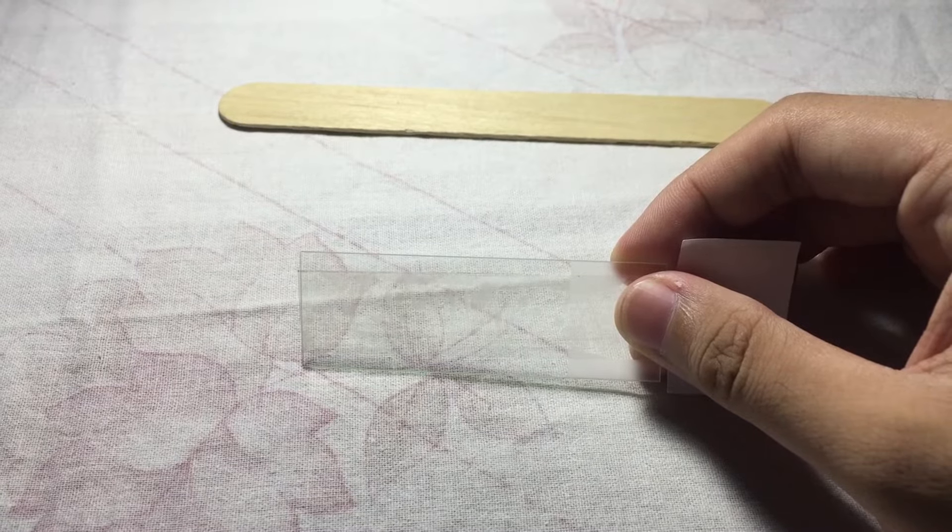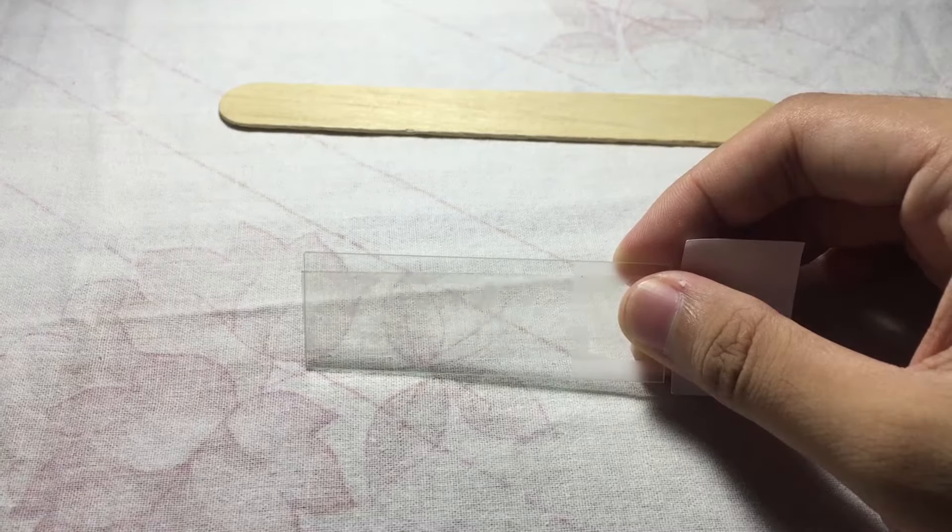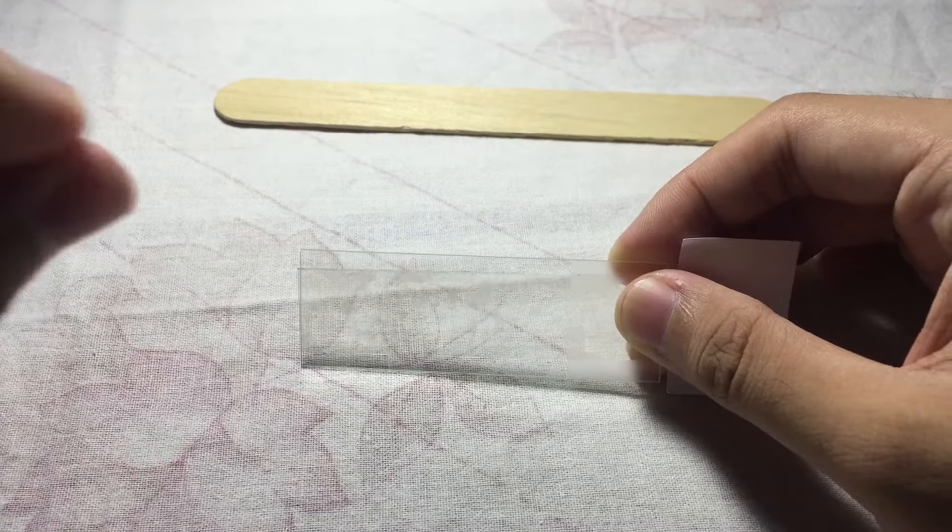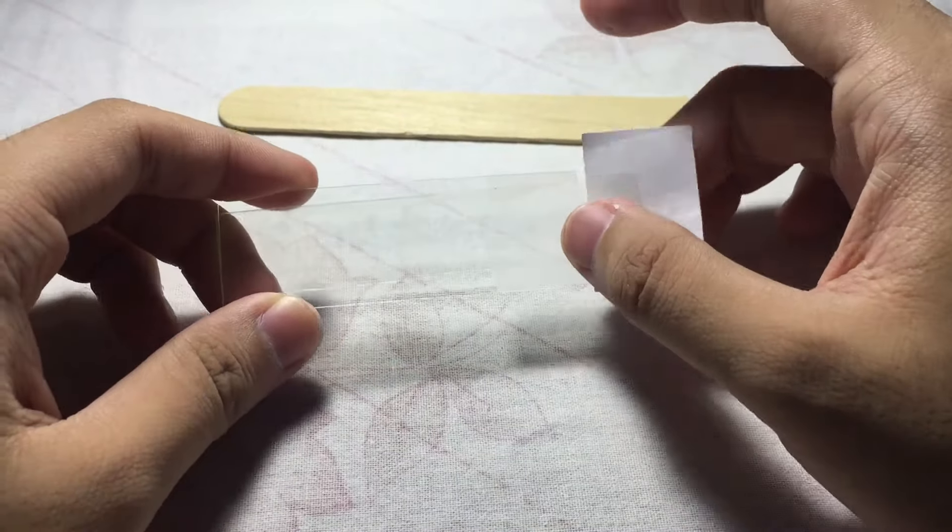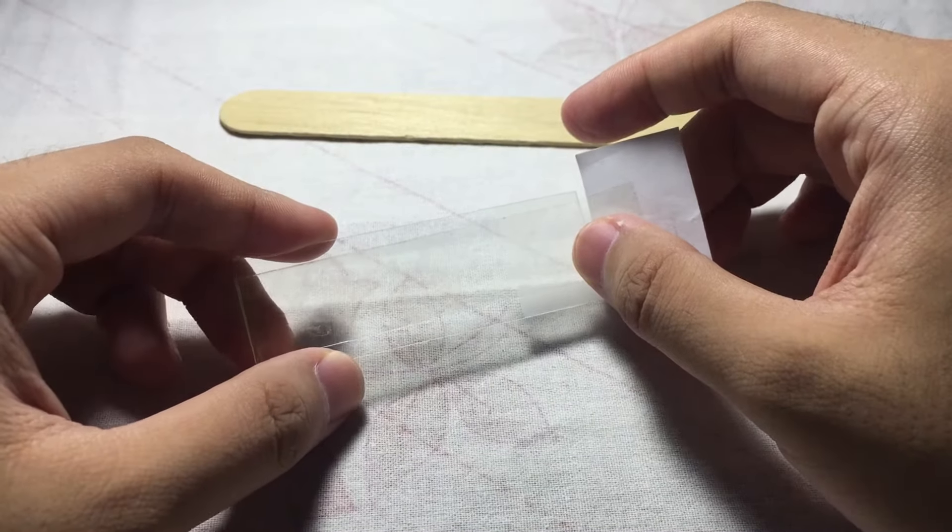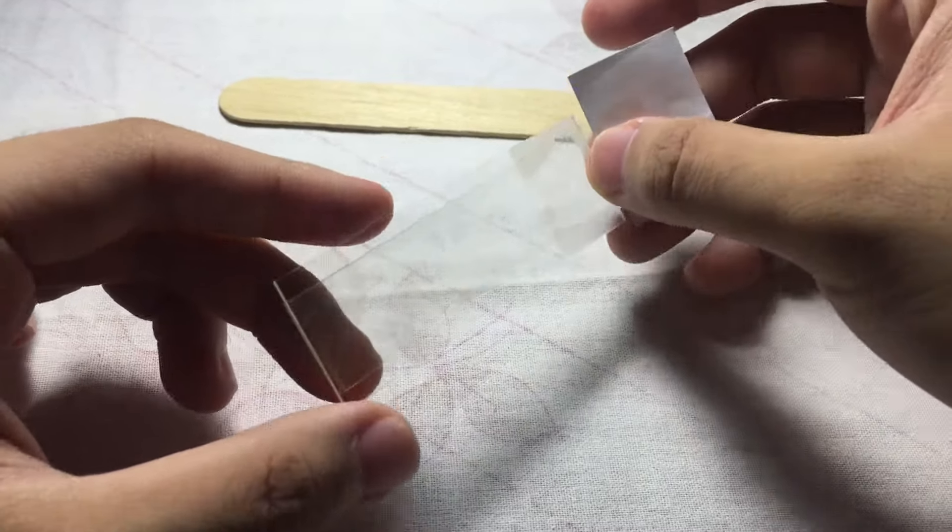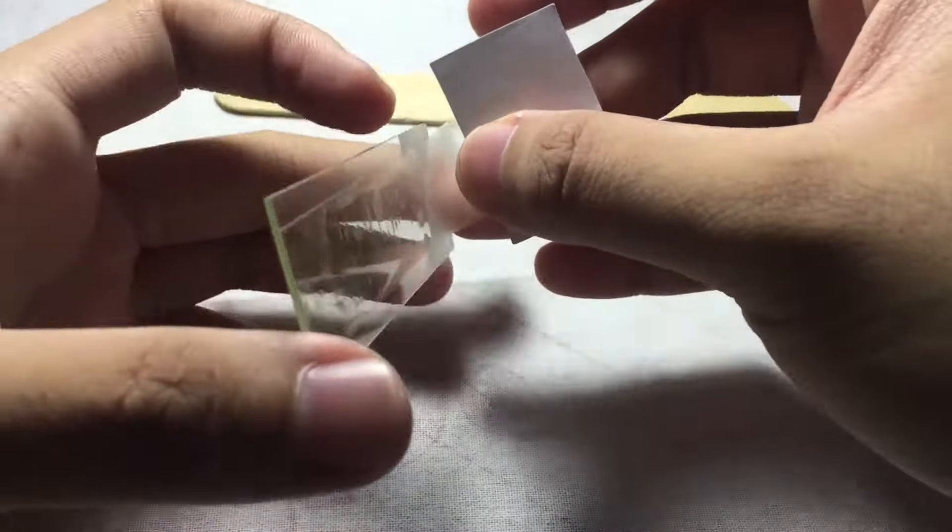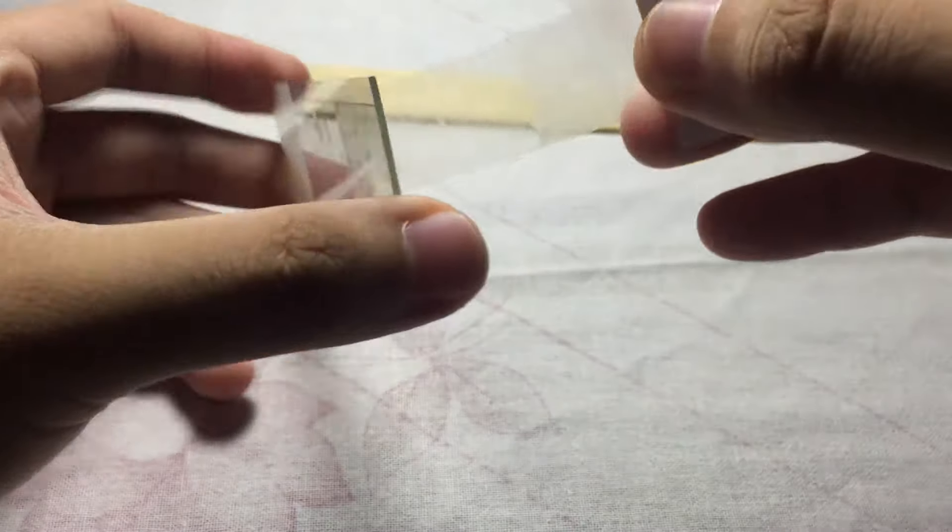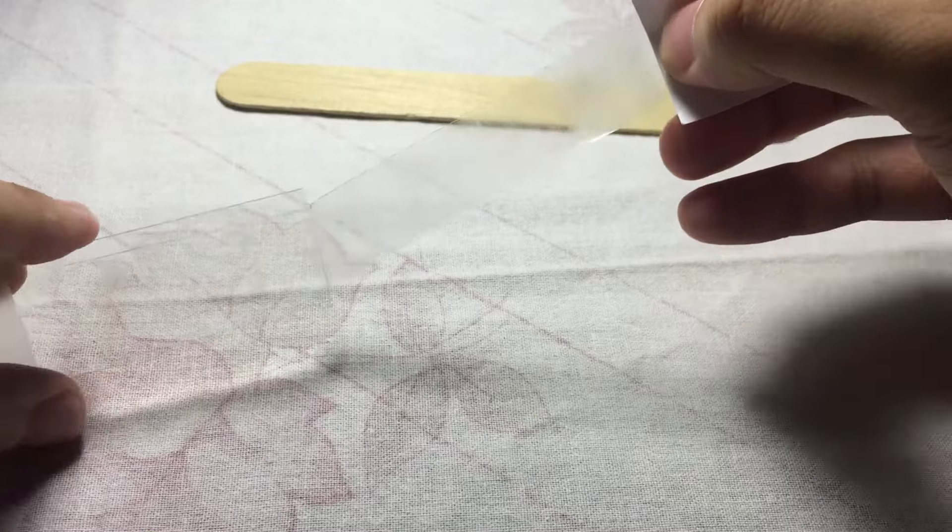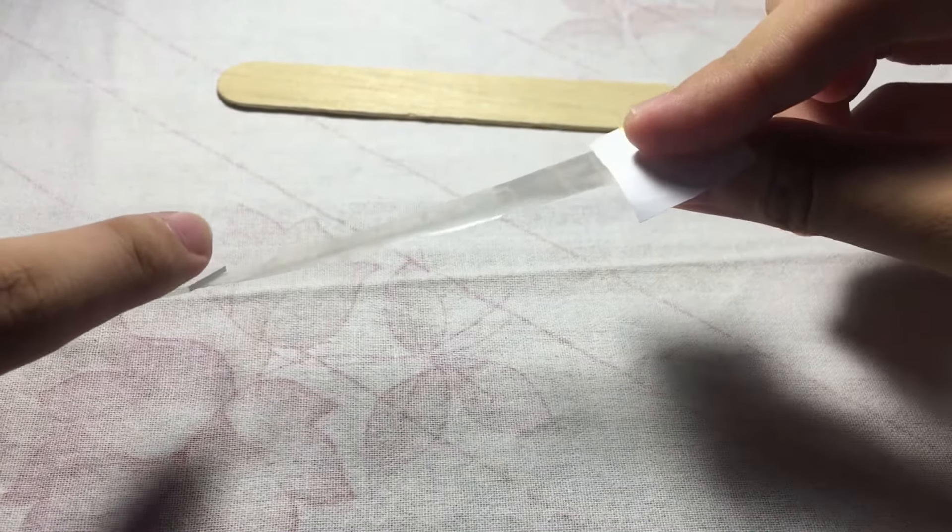Let's say that the criteria for timing of collection has been accomplished. We go now to the proper sample collection. First, using this flap, we open your slide. So as you can see, that is now the sticky end, and it will stop at the edge of the slide.